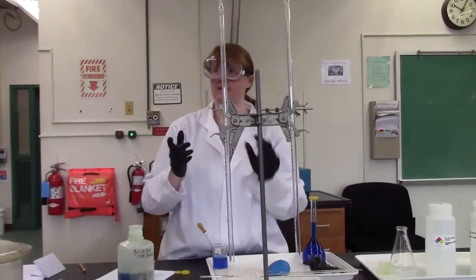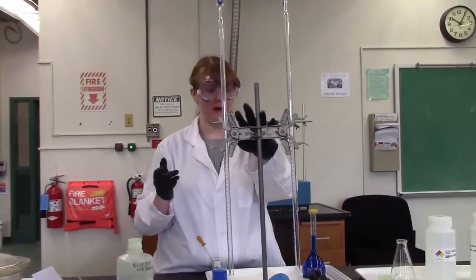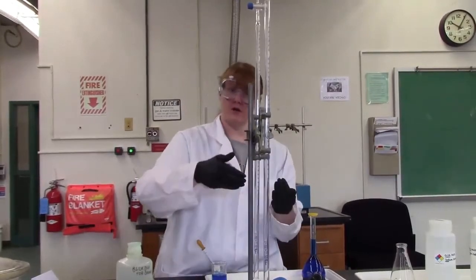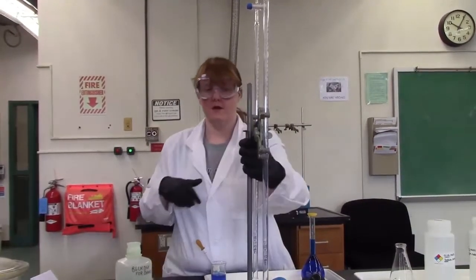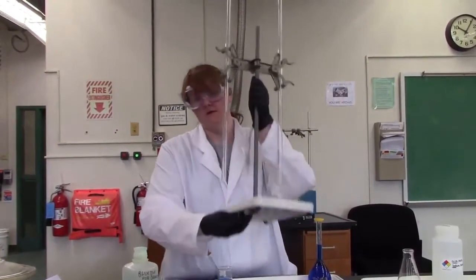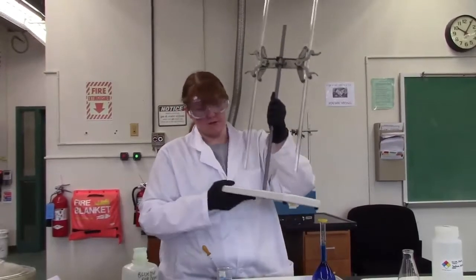You'll really only need one of them. They all come with two at a time. If you're in a full lab then what we can do is turn it sideways and you can share across the table from each other. If you don't have a full lab I recommend getting your own and not sharing. It's a lot easier than reaching across the table.